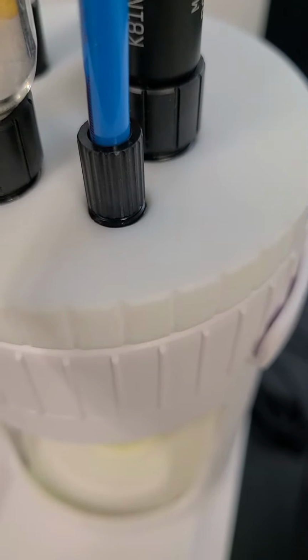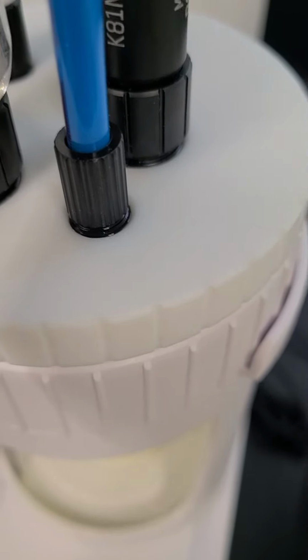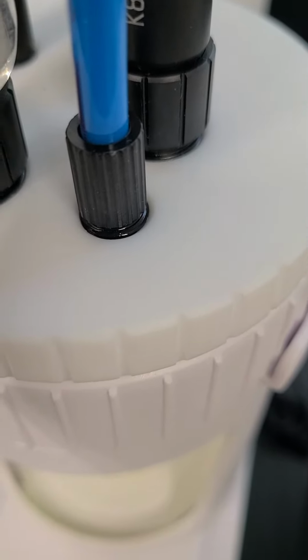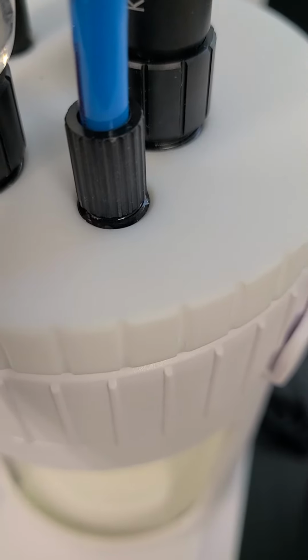So if I leave this going, you can kind of see it starting to pull down there. It'll actually start to come out the sides here if I leave it just pre-titrating. So ideally I wouldn't stain the top with the composite 5. Let me know your thoughts.